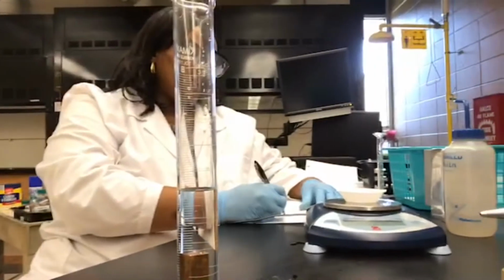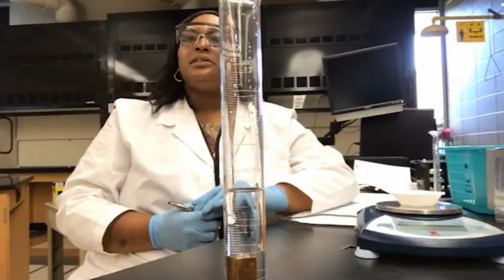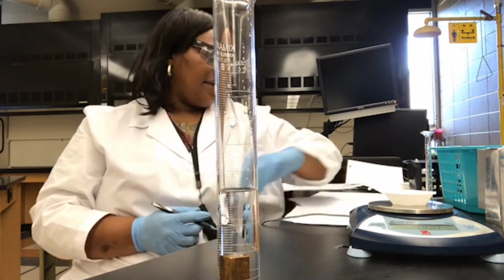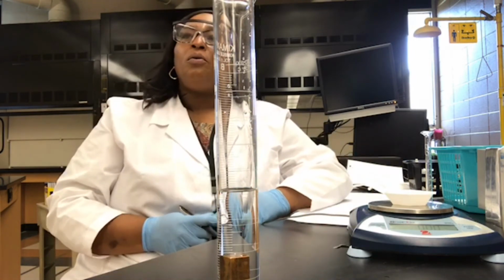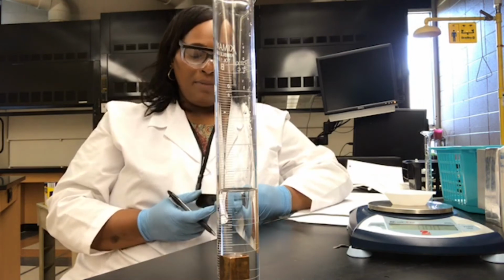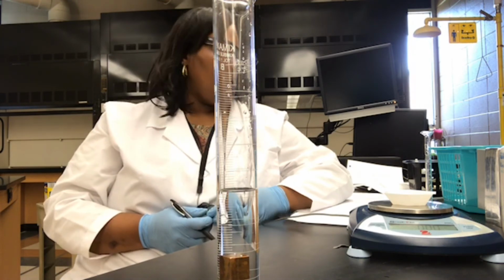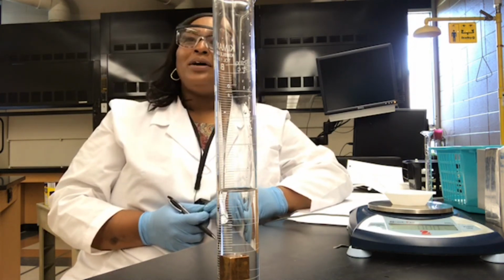Notice that the units of density are grams per milliliter. The units for density for our block and for our water in the previous part, make sure you write the correct units for density as grams per milliliter. And of course, show your calculation for determining the density of the metal block. So do your final calculation, compare with your partners by going to your group meeting room and then returning to the general meeting area where we will wrap up the lab, talk about your results, and answer any questions that you might have.